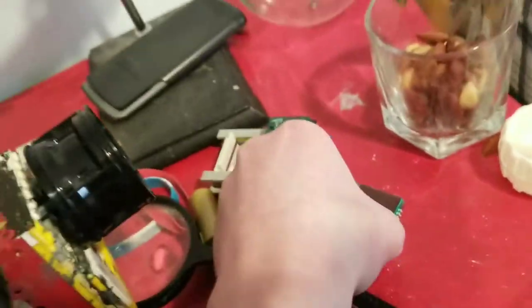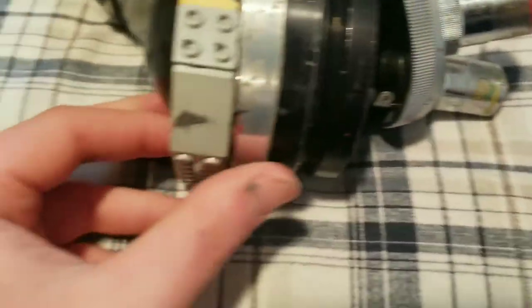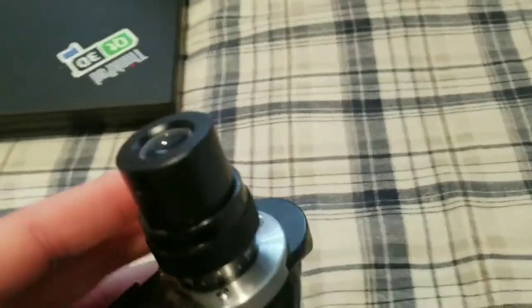And when you add them to the top of here, it's just too big and clumsy. I was going to add one to each eyepiece, but it's just too big and clumsy. So anyway, I'm going to have to add the polarizer filter in here. Now to disassemble this thing, which is the head of the microscope. Right here is the internals, and this is going to be a pretty good place to add one of the polarizer filters. We will only need one, since this outlet leads to both eyepieces.